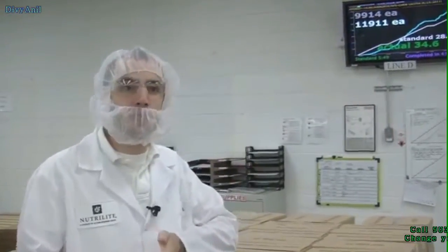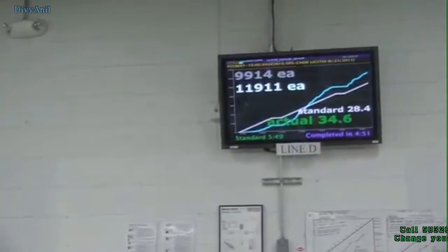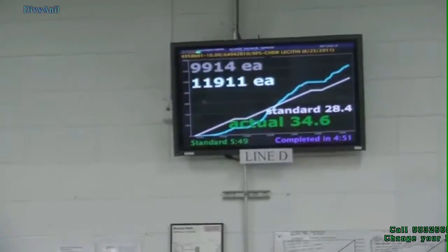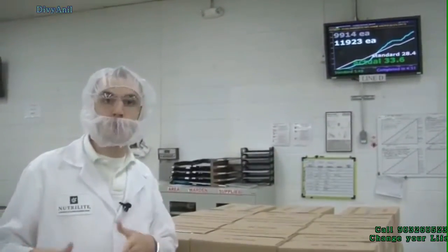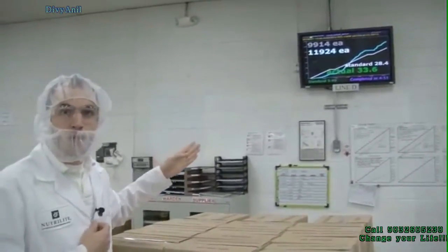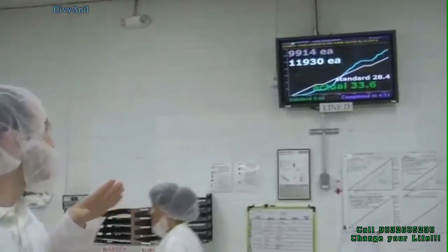This is our Visual Factory system. Visual Factory is meant to show the production of the line throughout your order, throughout the day, throughout every shift. Right now you can see two different lines on Visual Factory. You have the gray line — that's your standard line, the rate at which the line should be moving. The other line, the blue line, that's the actual rate at which the line is currently running. You can see when they started this order they started a little slow, but they eventually made it up and now they have far surpassed the standard line.